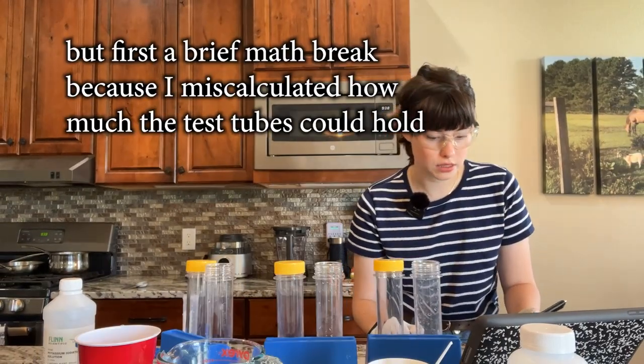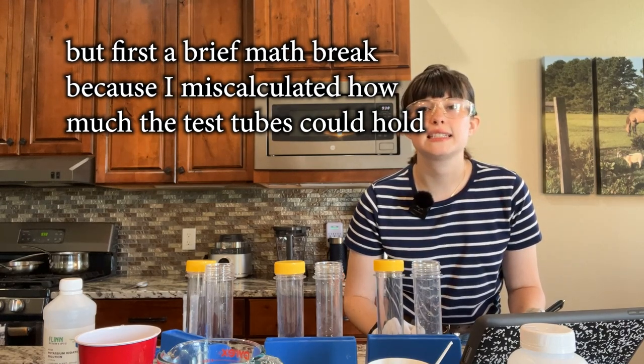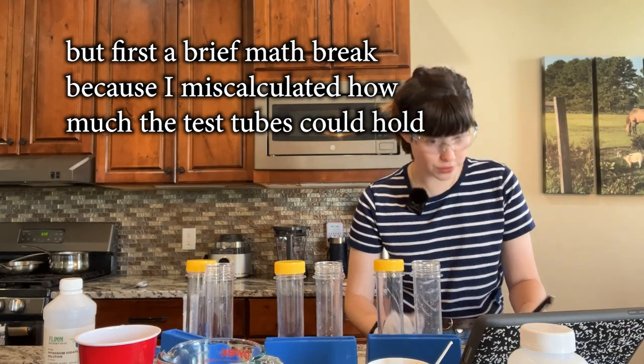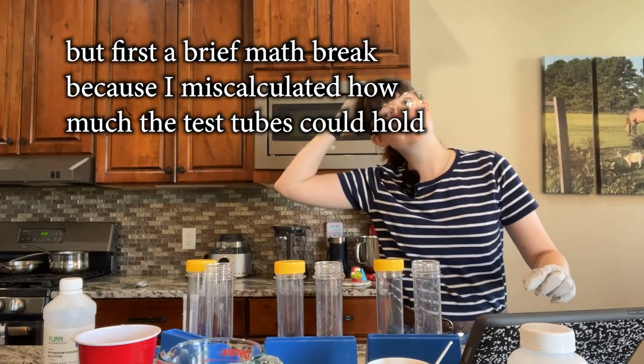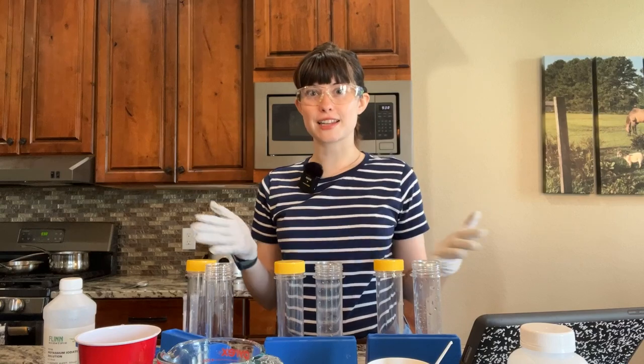10 and 50. 50, 30 divided by 2 is 15. 50 plus 15 is 65. 65! All right, let's try that again. All right, now that I've recalculated, it's time to fill them.